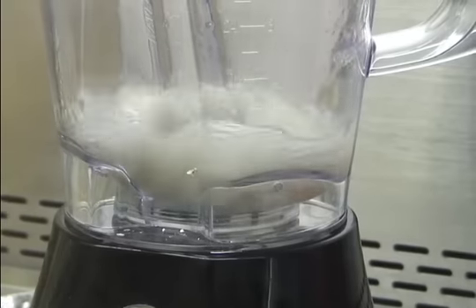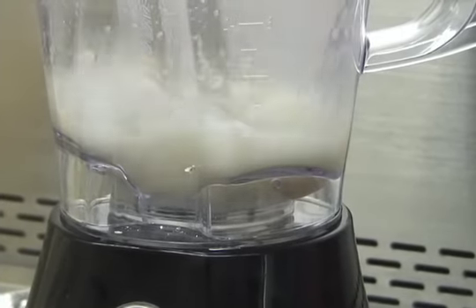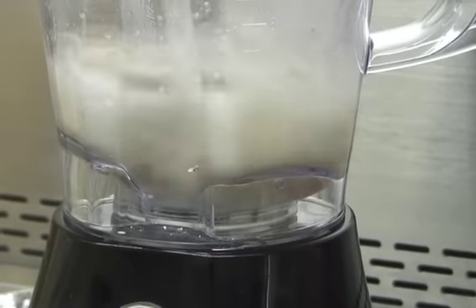I like to pulse it first just to get all the chunks broken up. That's nasty. And then just let it go.